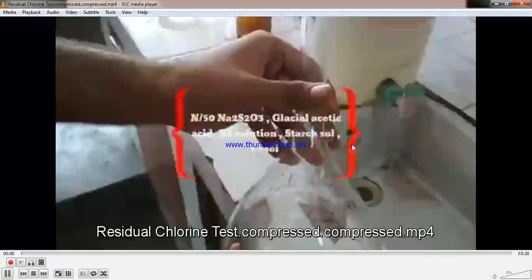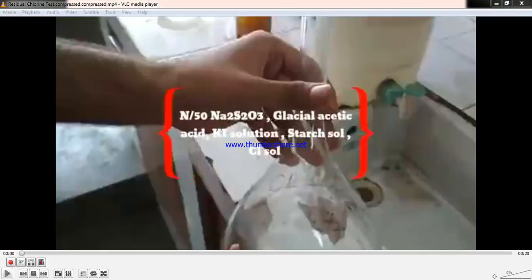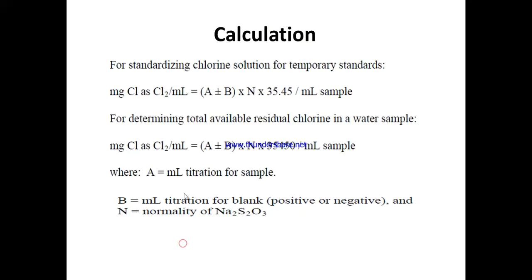So we have noted down the initial volume of Na2S2O3 in the burette. Then when the color had changed to straw yellow, we will note down the volume. Again, when we have added 1 milliliter starch solution indicator and it has changed into blue color. After that, when it turns colorless, we will again note down the volume. So I think the procedure is clear to you all. Now let us go to the calculation part.